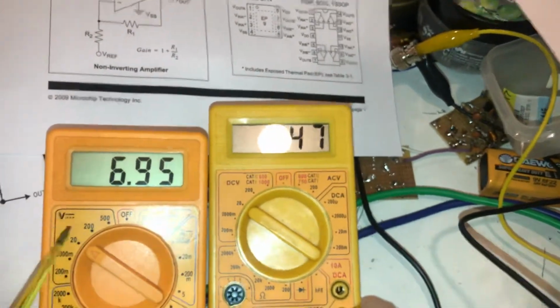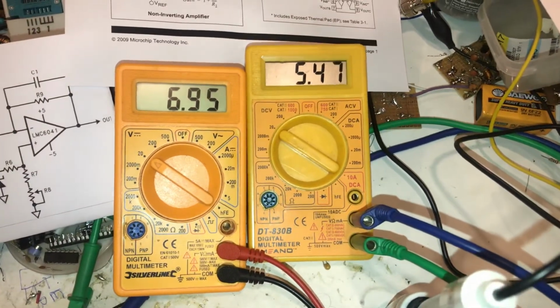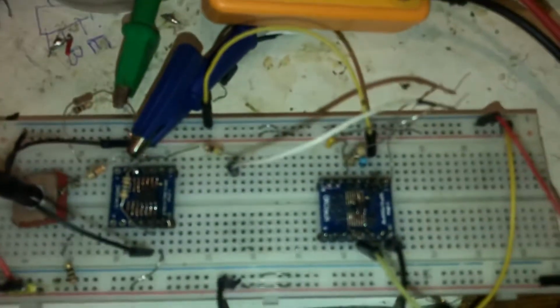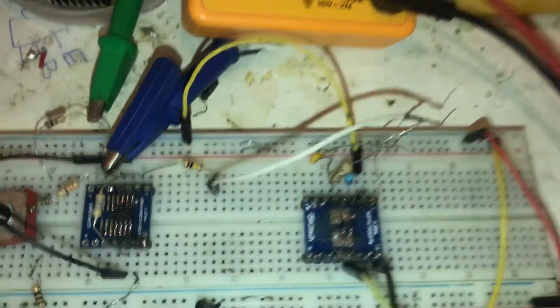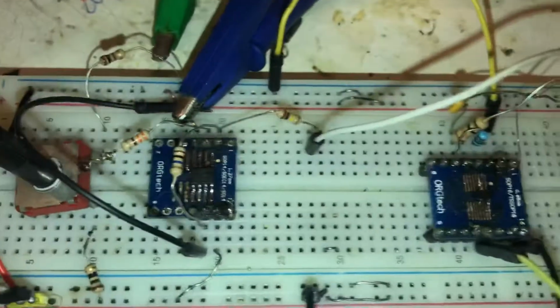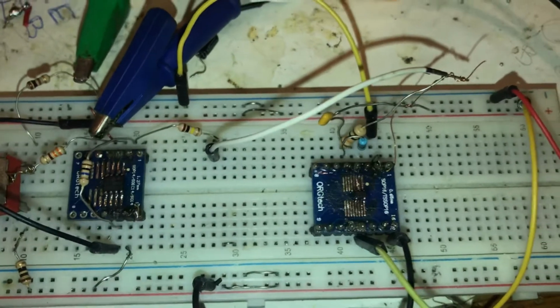The left meter is the half voltage input. I use the SMD SOT-23 version of the MCP6001 and the SMD version of the MCP6041, working very nice.